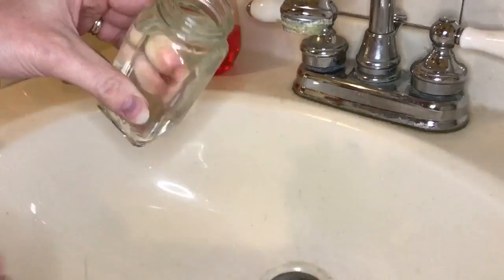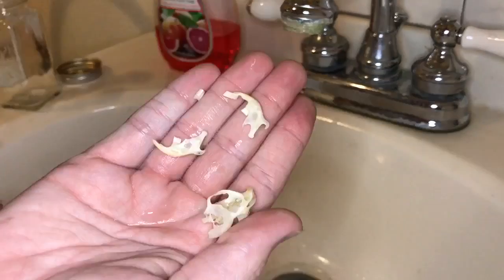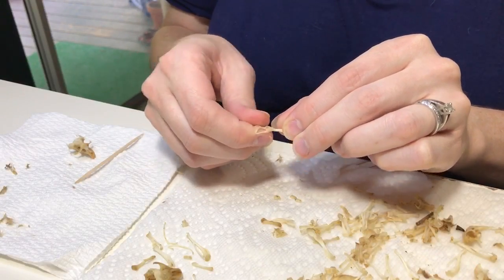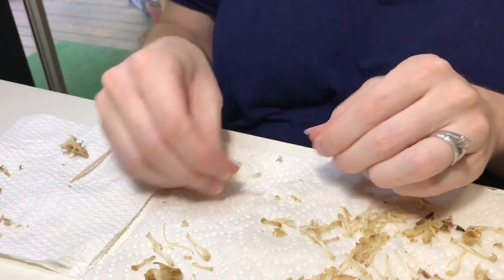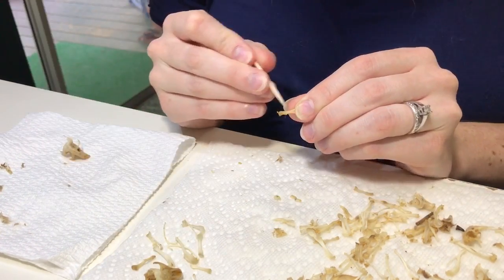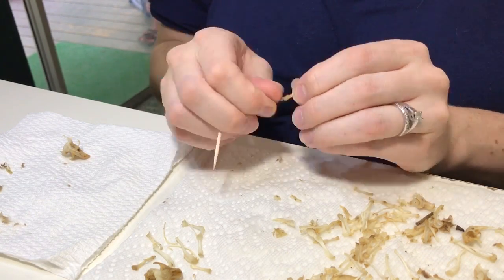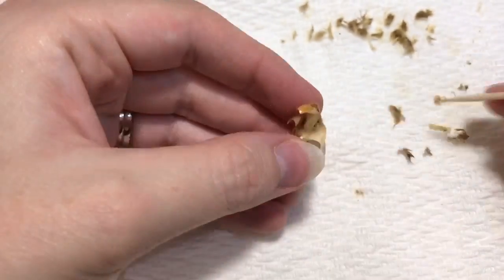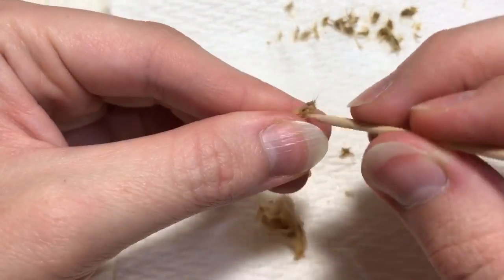I let them sit on my desk. Depending on how dirty the bones are, typically a day or two. But this is what they'll look like after a couple days. If they're still dirty, I'll put them in another wash — so two or three washes. Once I take them out, there's still going to be little wet clumps of fur on them, so I'll take those off with my fingers and a toothpick and just work those off so they'll be nice and clean. Obviously you have to get in the nose cavities, which is not so pretty, but definitely necessary.